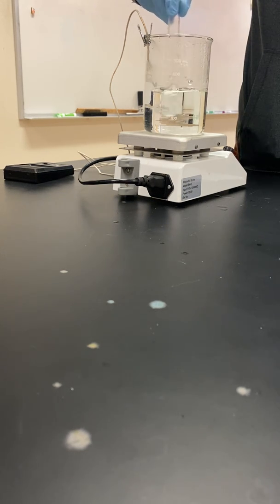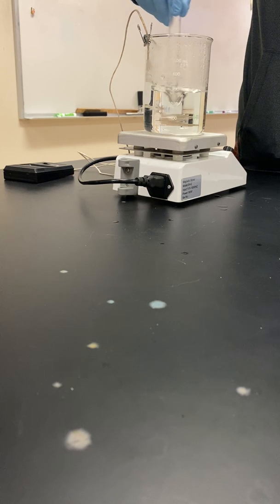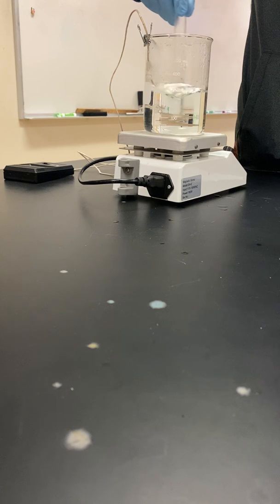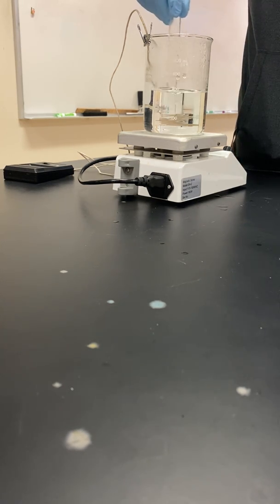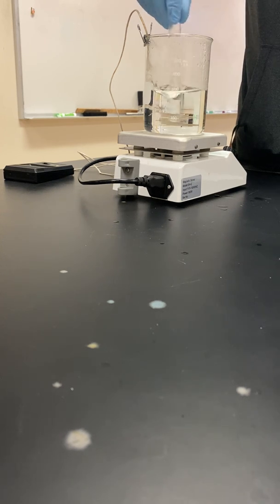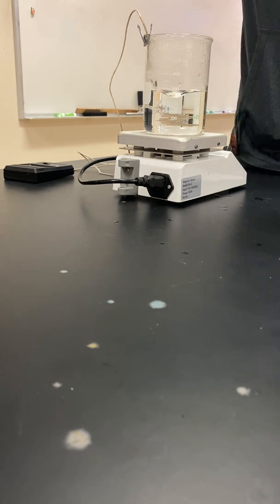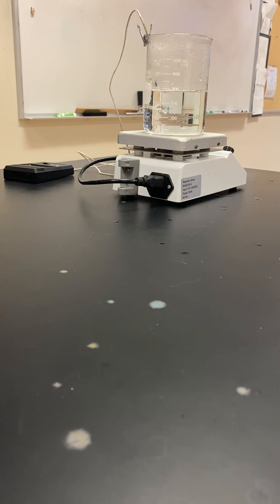Almost... almost so close. All right, that looks to be dissolved to me. So I hope you would agree that that appears dissolved.